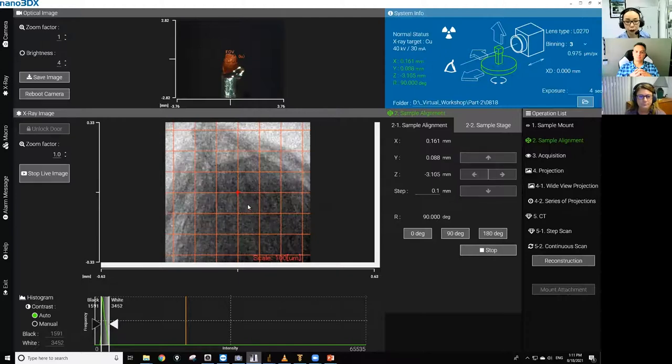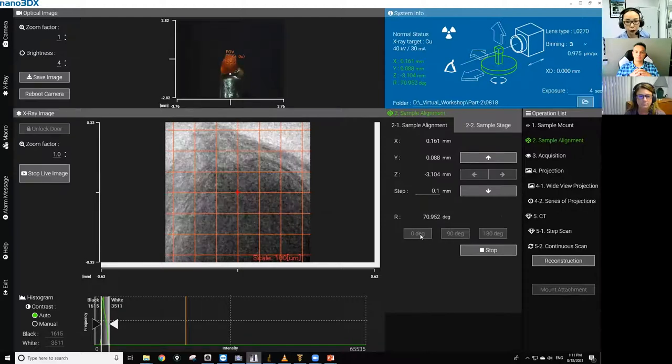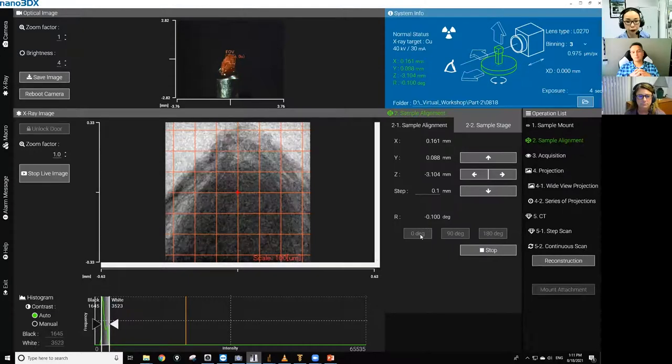And I can do the centering either in the X-ray view or the CCD view. Okay, I think that should do. We should be able to see some details in this. I'm going back to zero. Okay, and stop this.